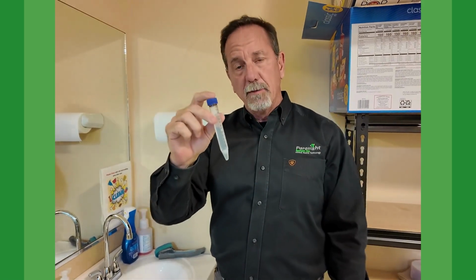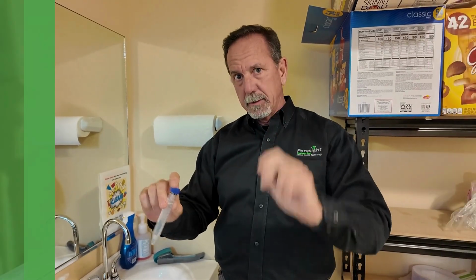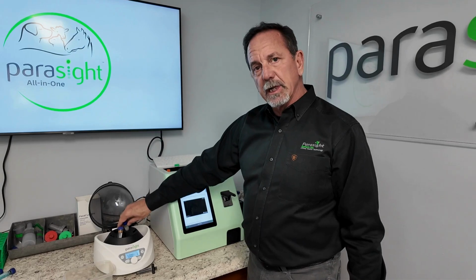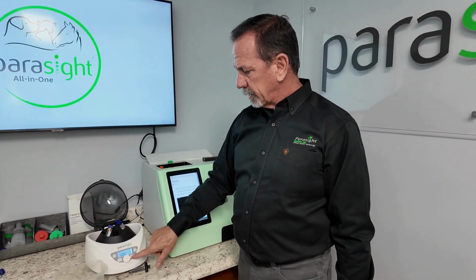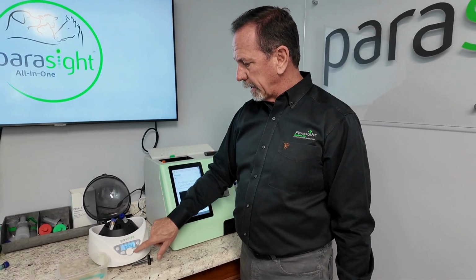Then we're going to walk over and place this into the centrifuge for 2 minutes. Now I'm going to place this just like we do normally. We're going to put that in the centrifuge. We'll set that up for another 2 minutes.